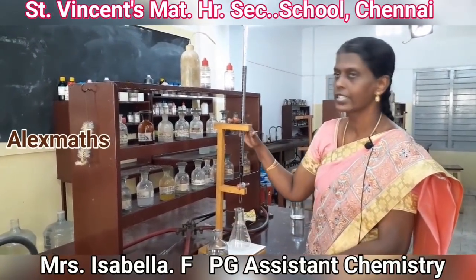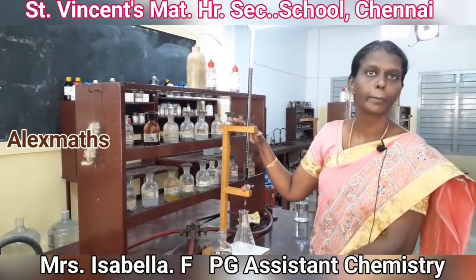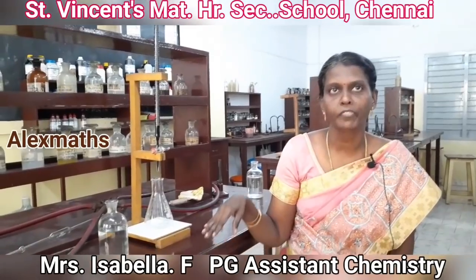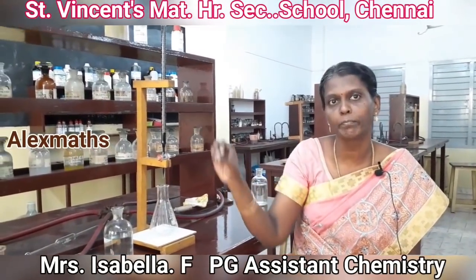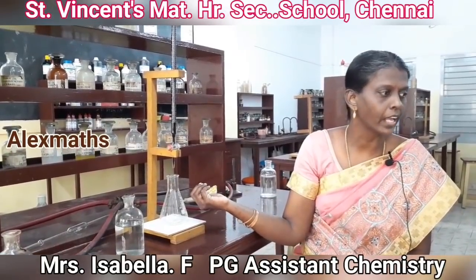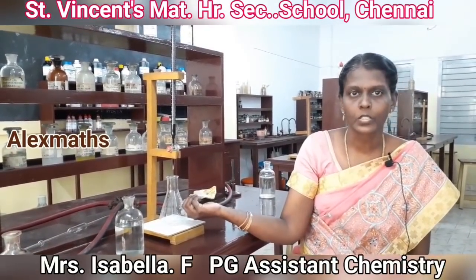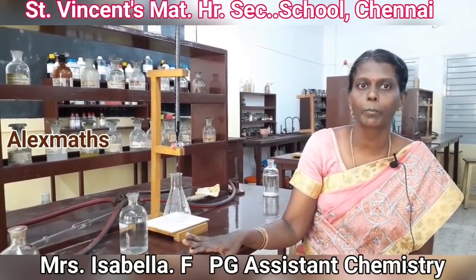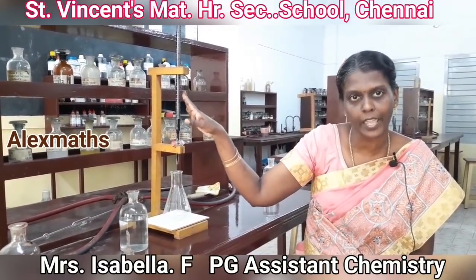This is the first titration, titration 1. So we have completed the first titration. So in the first titration we had taken potassium permanganate in the burette and ferrous ammonium sulphate was taken in the pipette. So that is your first titration. Now for the second titration, the burette solution will remain the same.